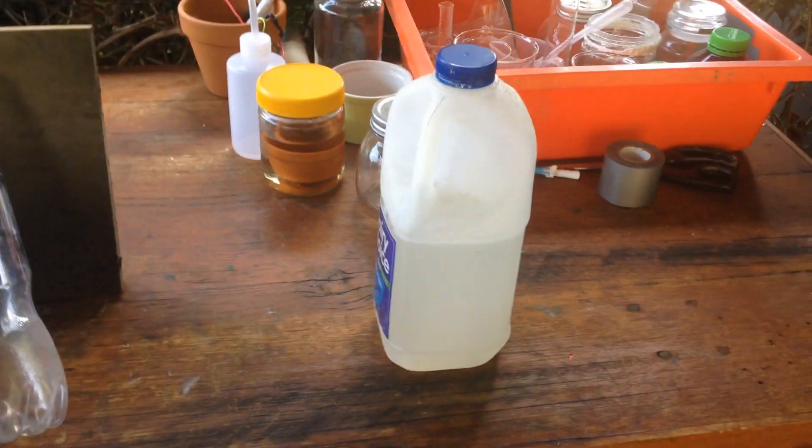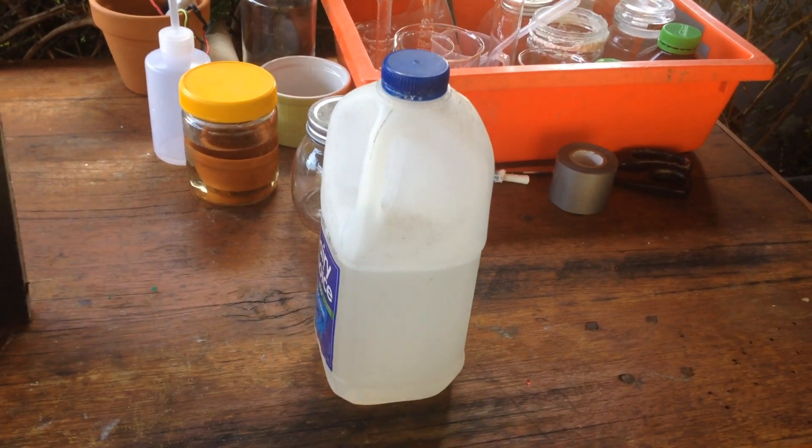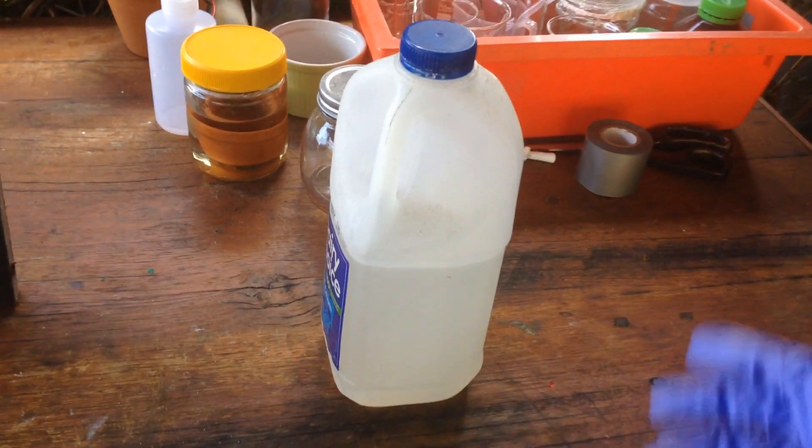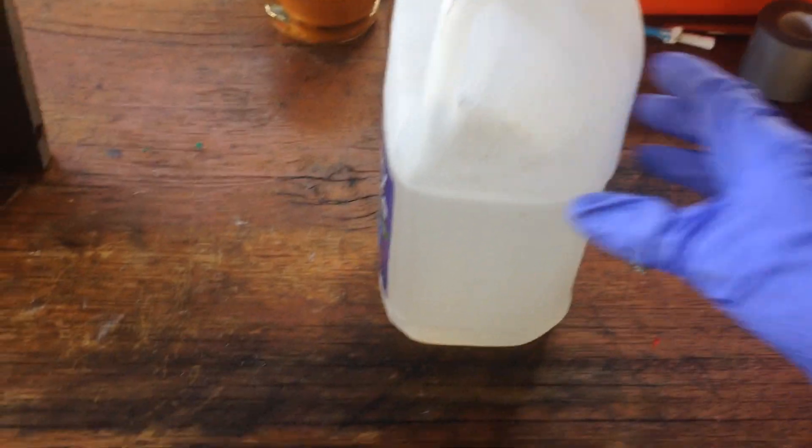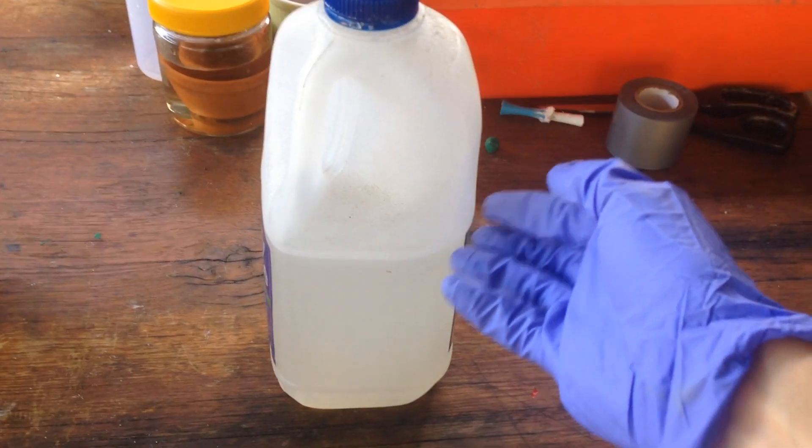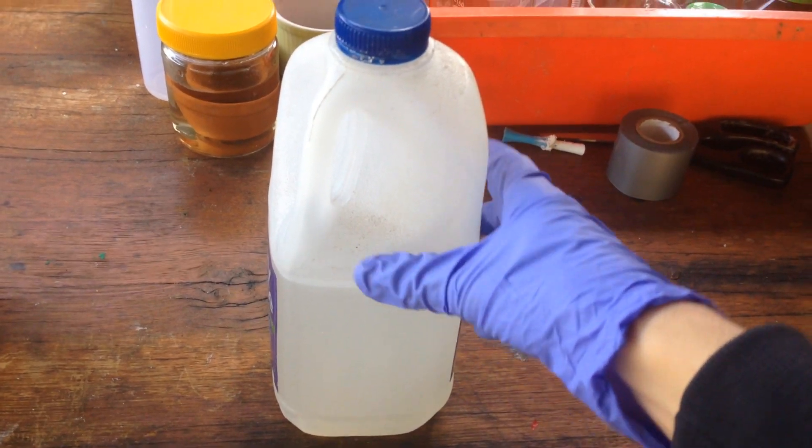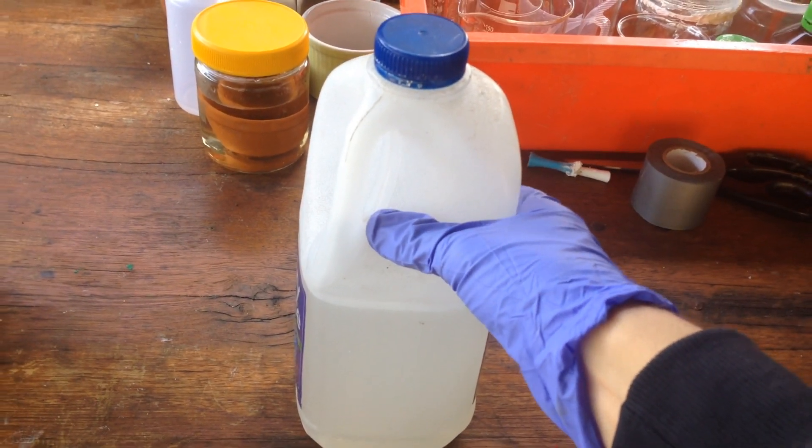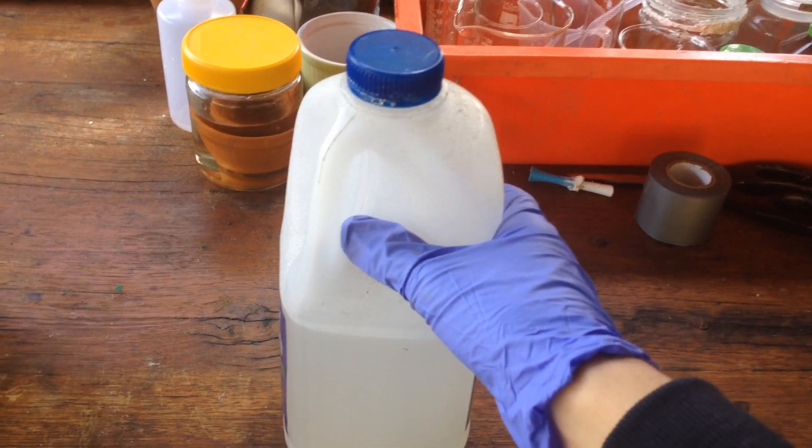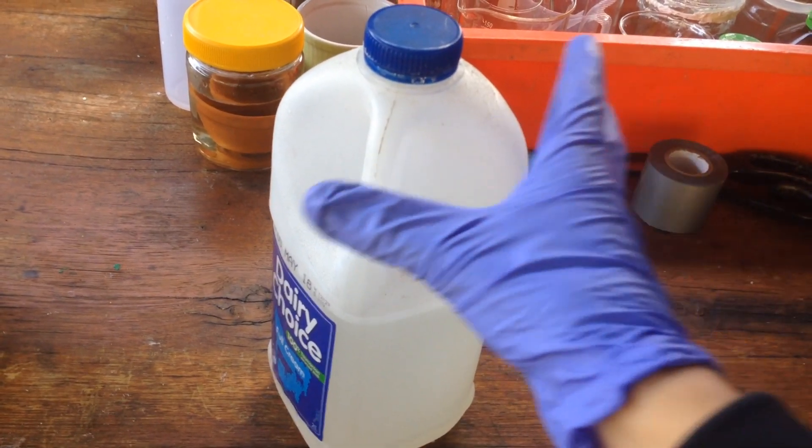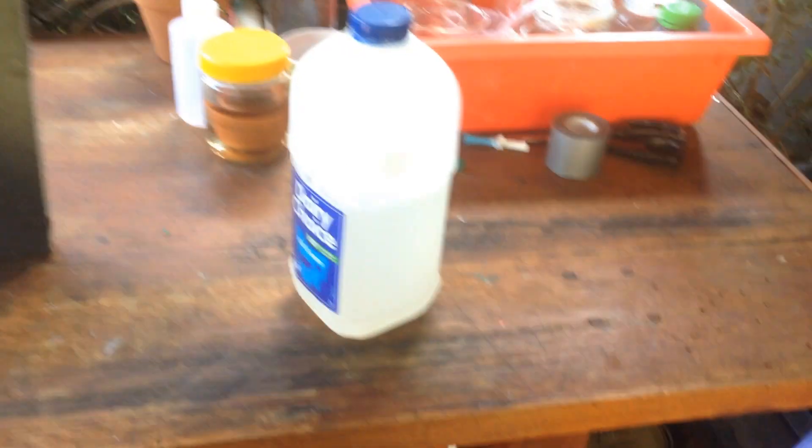So, enriching heavy water. It's been over 8 months since I started this project, and so far, through our little electrolysis cell down here, we have amassed approximately 1.4 litres worth of concentrated deuterium in water. Hopefully it's around 8 times concentrated, based on the separation factor of electrolysis.